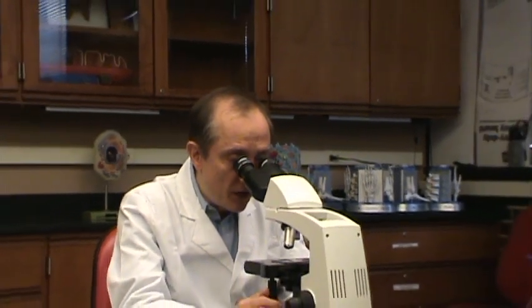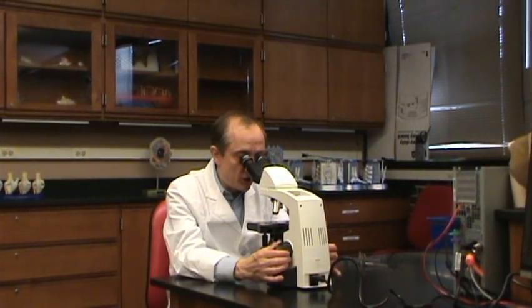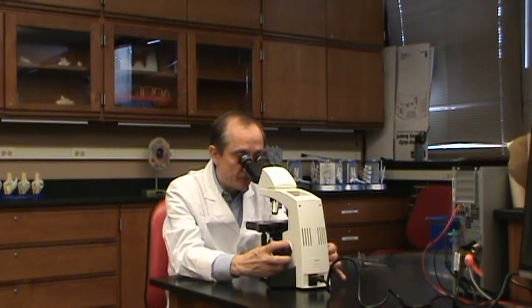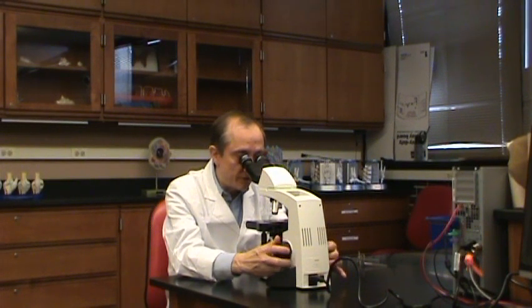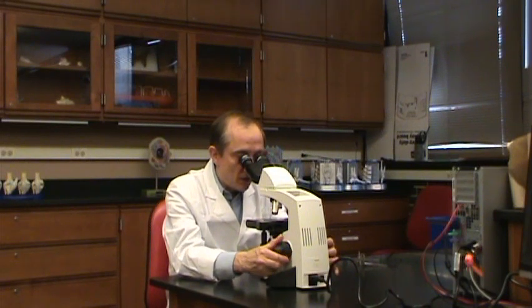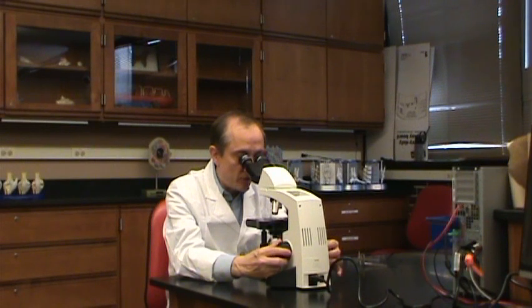Still on low power, I go back in and use the fine adjustment, bringing the stage up slowly to bring it to focus. Now I'm in focus.